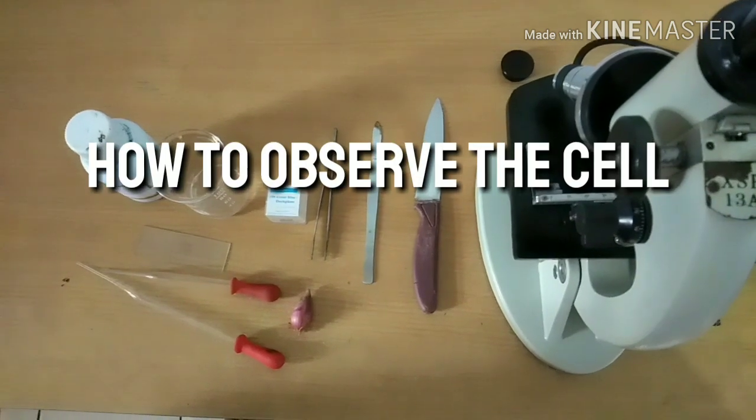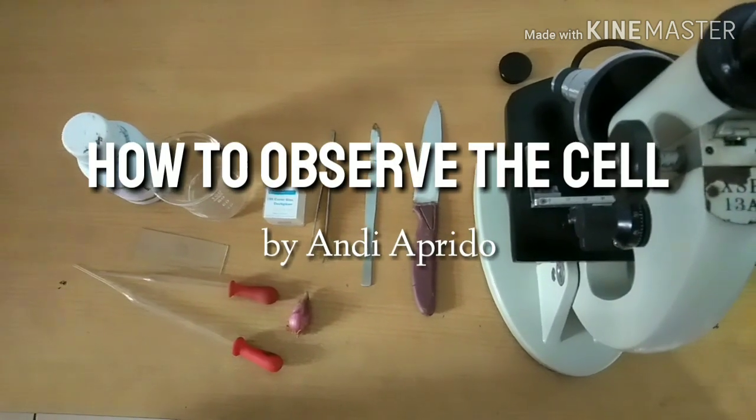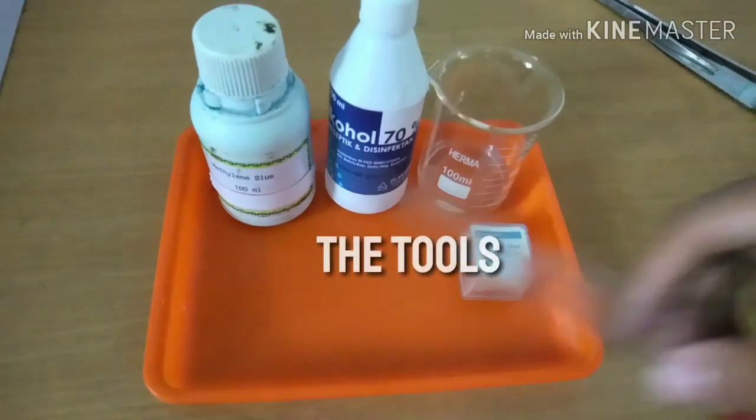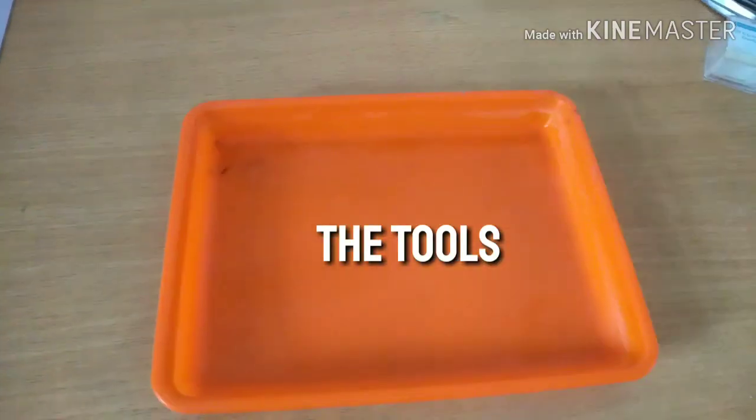Hello, I'm Andy and I'm going to show the way how to observe the cell. Before we start, there are some tools that we need to prepare.